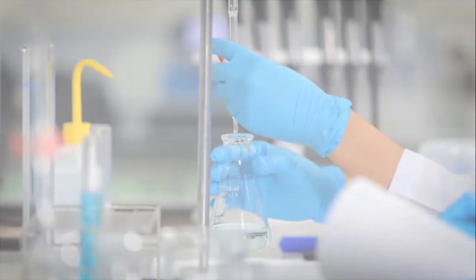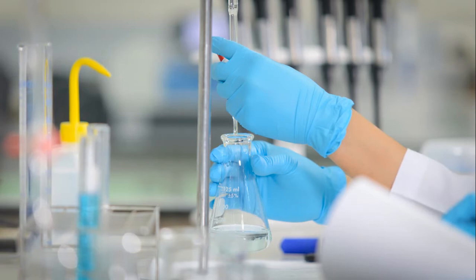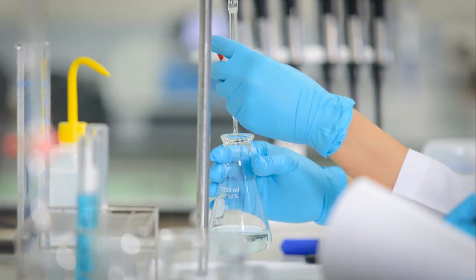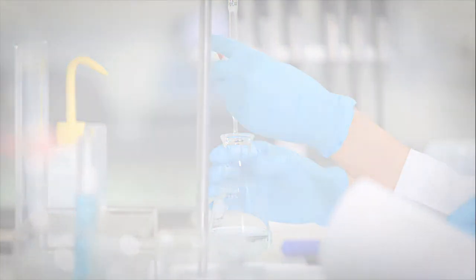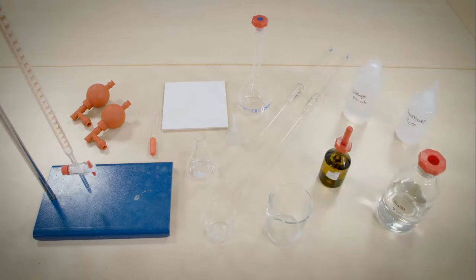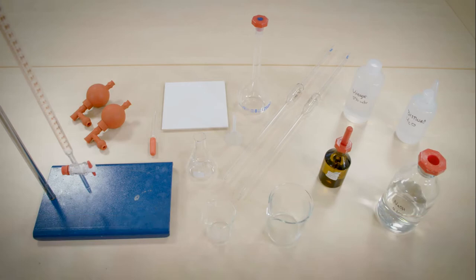Volumetric titration is one of the major techniques used in quantitative analysis and utilises volume and stoichiometric equations to measure the concentration of a chemical in an unknown solution. The simplest type of volumetric titration is between an acid and a base. In this experiment, the concentration of ethanoic acid in vinegar will be determined by a simple acid-base titration.